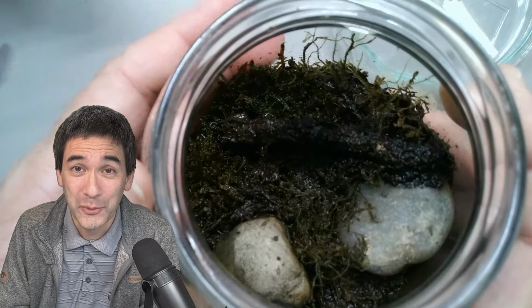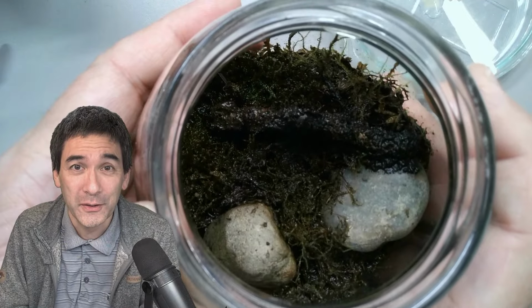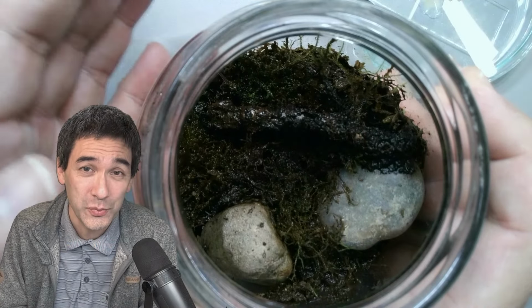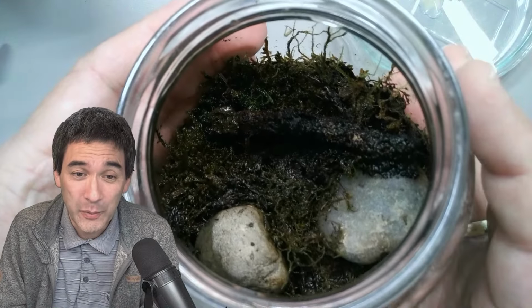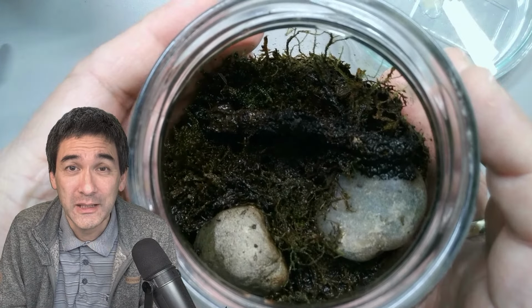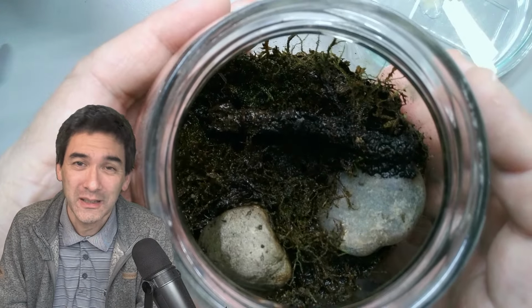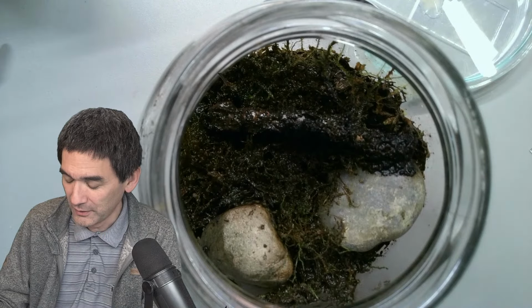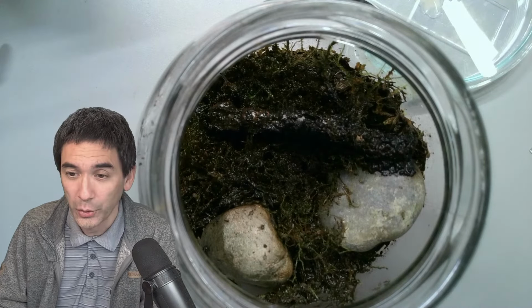And of course, I'm going to put it under the microscope. And I've also prepared a couple of other specimens. Some of them we've already looked at before, and I would like to see how they have changed over the months. Last week we did quite a bit of a deep dive and did some staining of bacteria, but today's session is going to be a little bit more loose and varied. So I've got a whole list of things that I would like to look at and to show you.